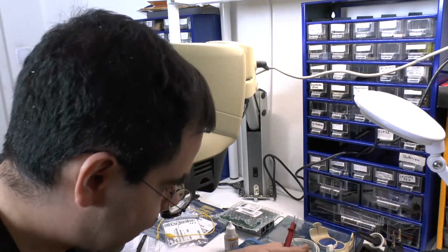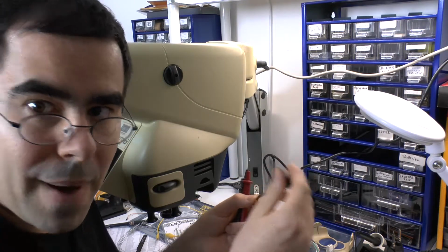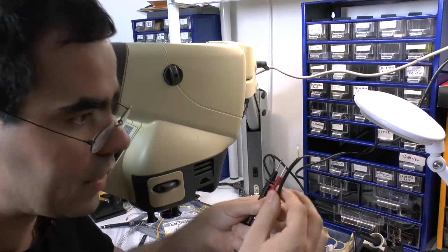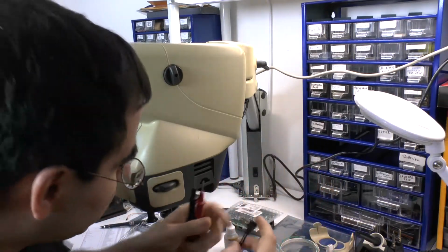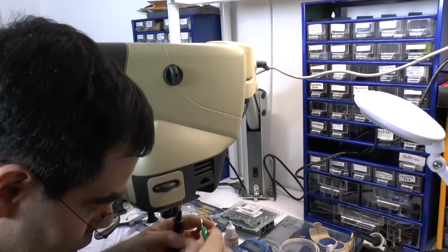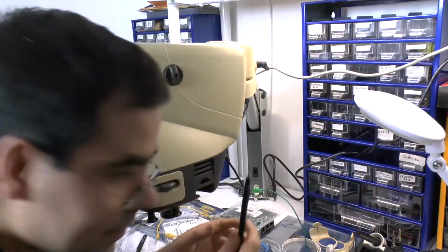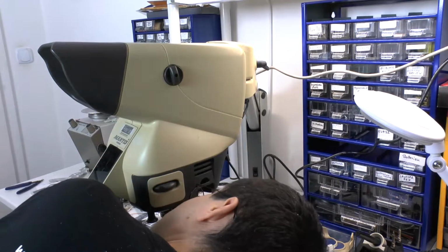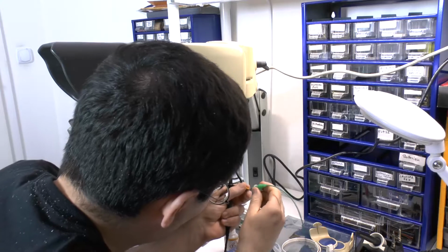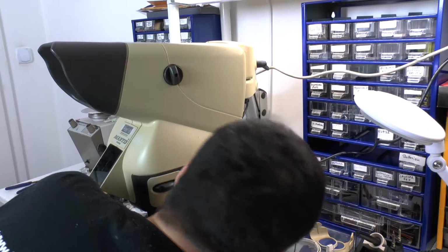The next problem is this connector. It's more or less a more beefy version of the mono connector, but, well, I cut it out here at the back and just in the middle, so in case I want to solder it together again, and tinned the two ends so that we can use it to beep out the connections. So I plug it in. I use an alligator clip for one end of the meter, connect it to the yellow pin, and now I can go in and I see the one thing beeps, the other thing doesn't. Now we go around the other way and I see the one thing beeps, the other doesn't.